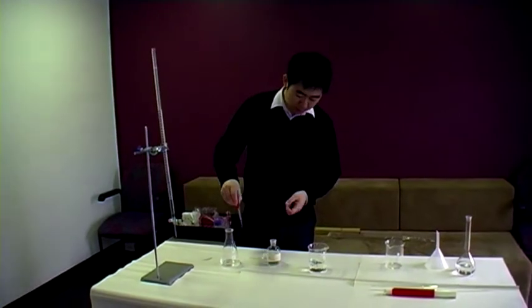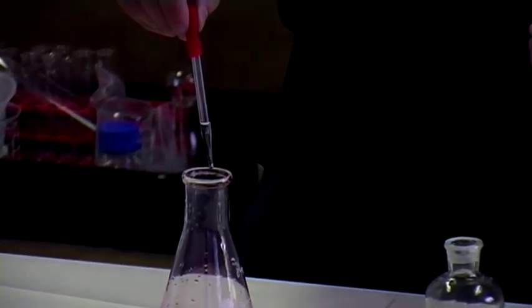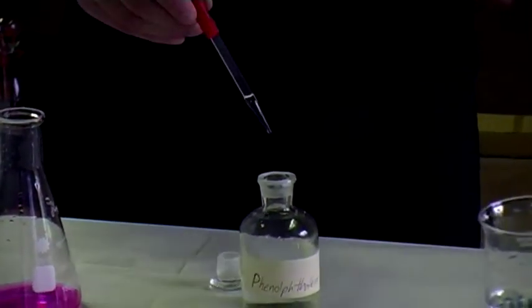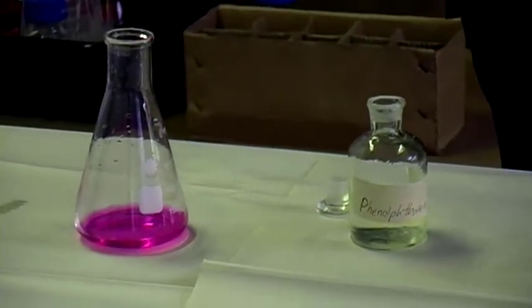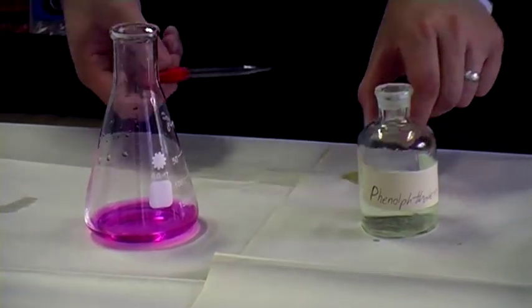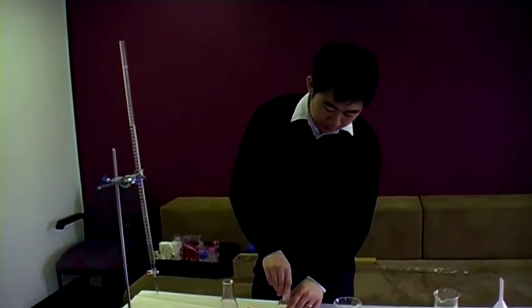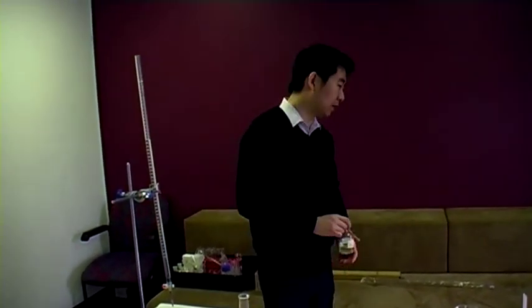The amount to add — you only need about 2 drops, maybe 3 or 4. Don't add too much, because chemical indicators themselves are weak acids and bases, so you're actually altering the pH slightly by adding a chemical indicator.